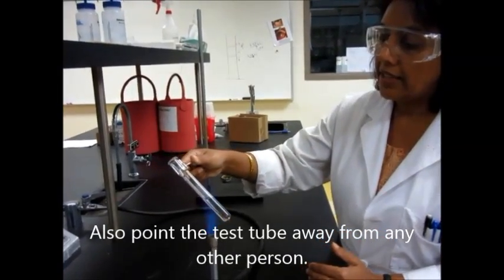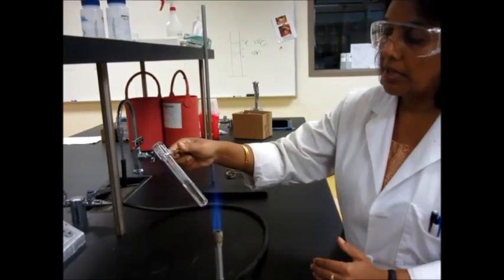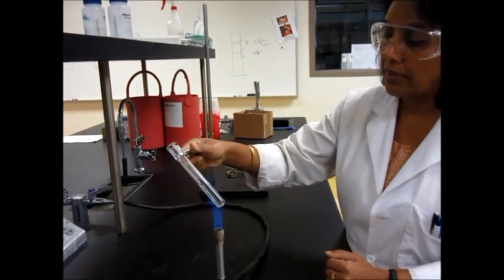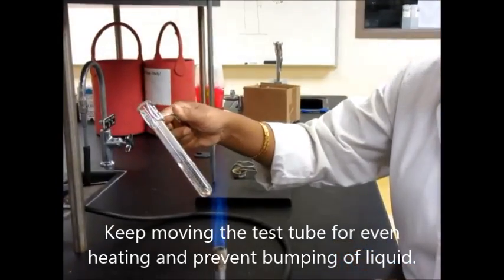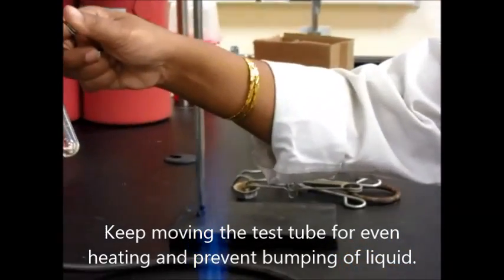The other thing is that you may also want to keep moving the test tube a little bit, so the heating is not too intense, and you can see that it's already starting to boil right here.